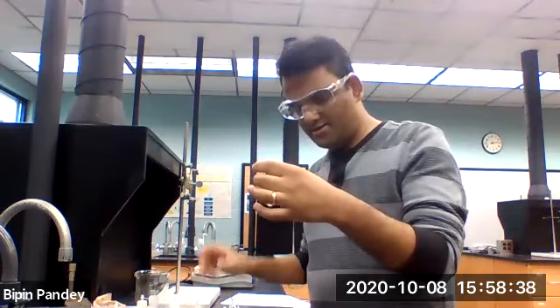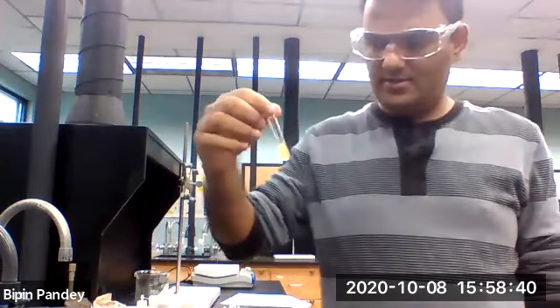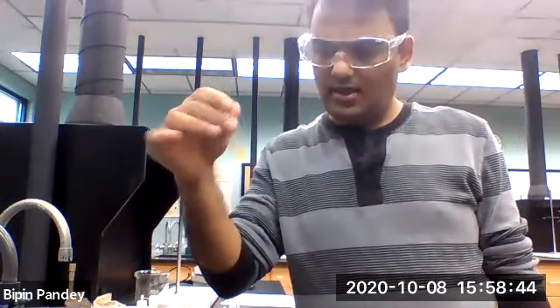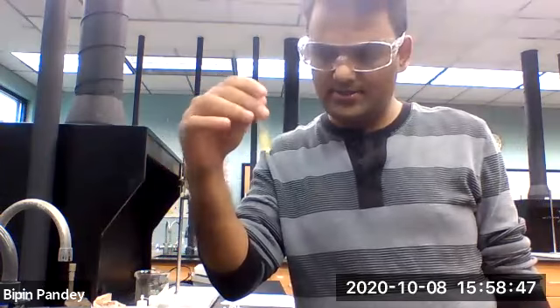So I don't see any reaction. The solution is retained, the color is retained, and I don't see any precipitate, so no reaction.